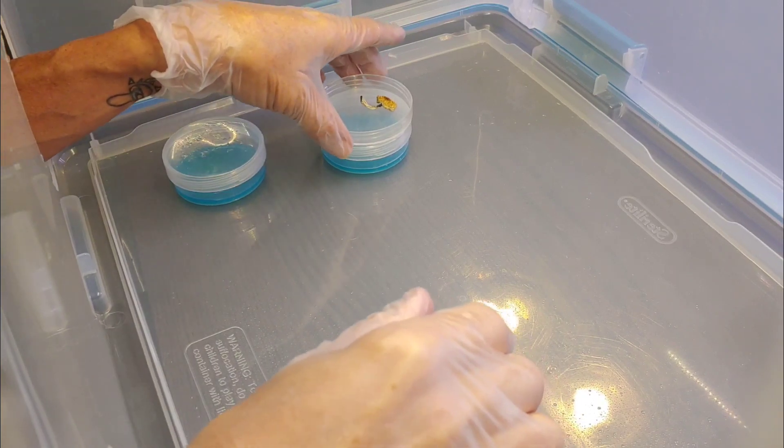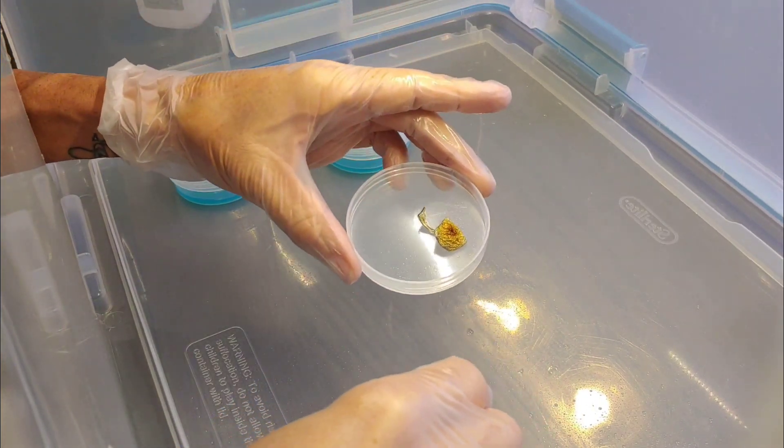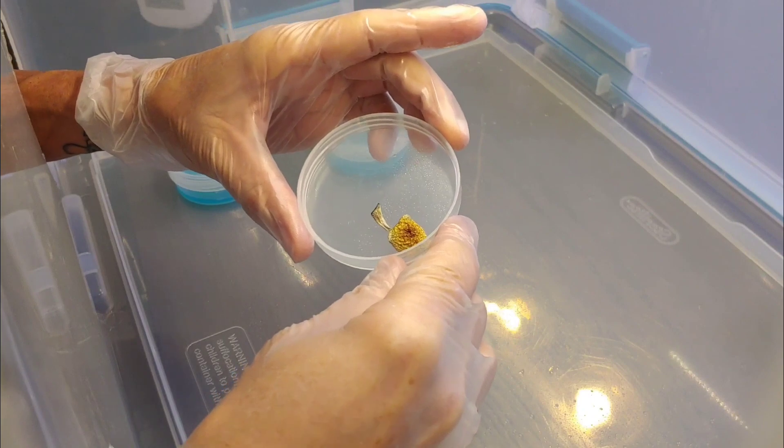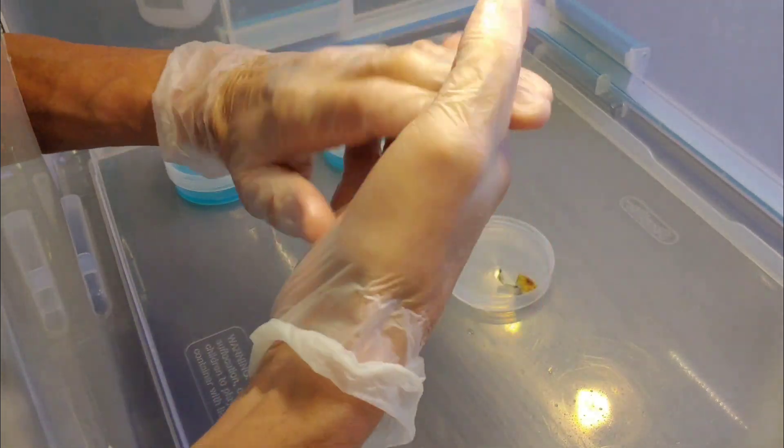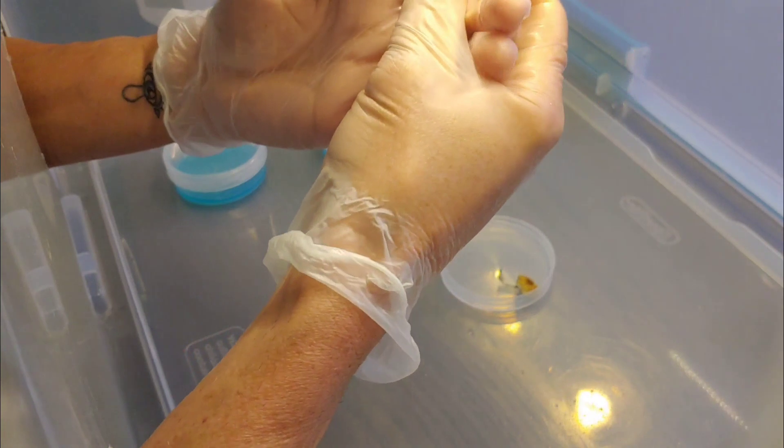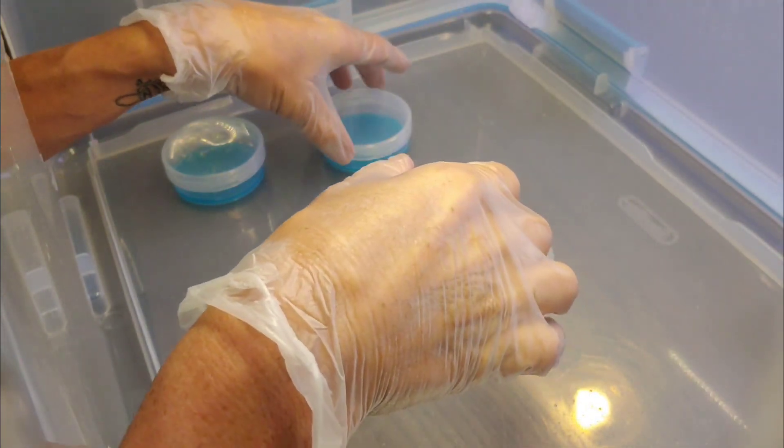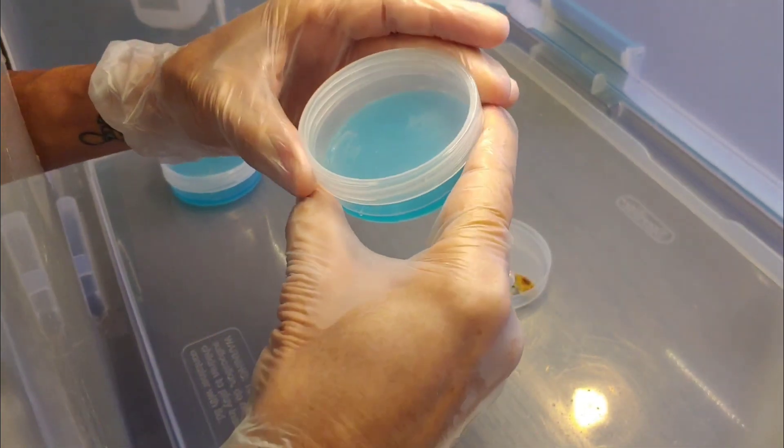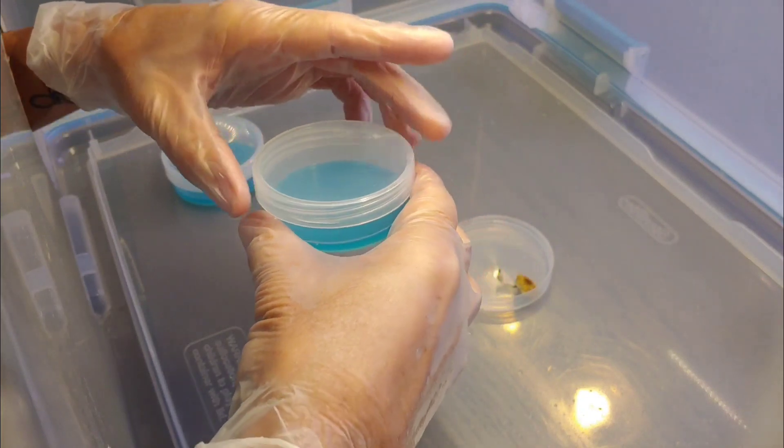So, we got our dried mushroom right here and clean hands with alcohol and we have two agar plates right here.